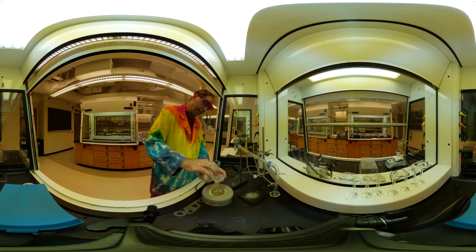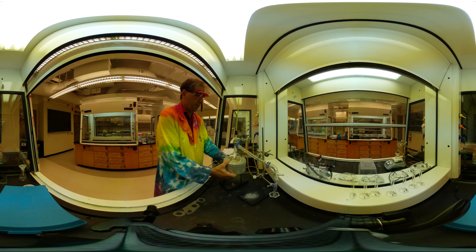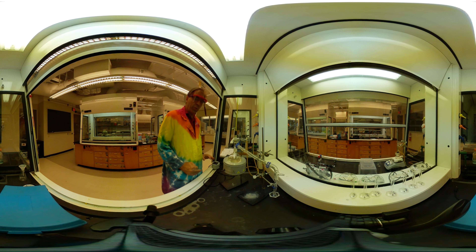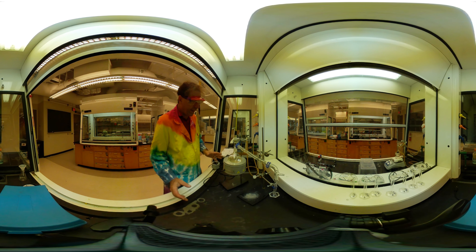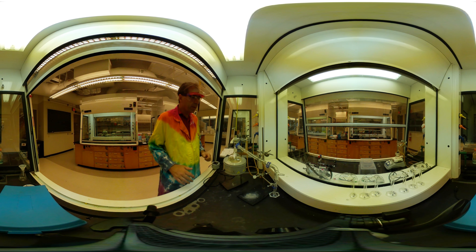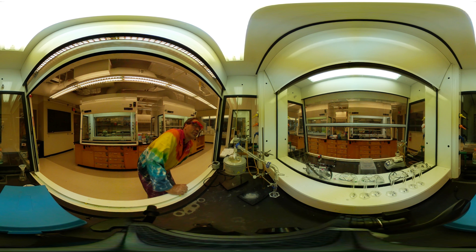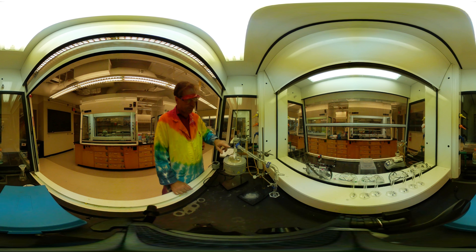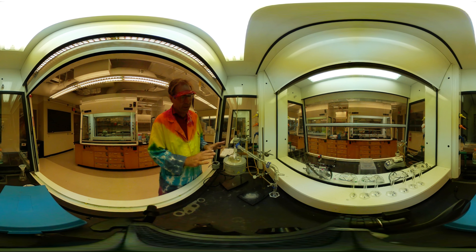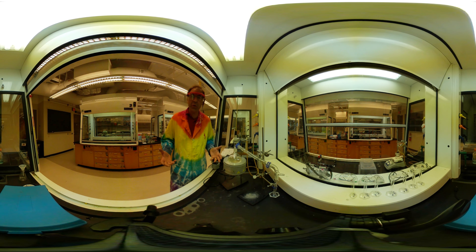Bring this up and get this all lined up to make sure we have a good seal here. I'm going to turn this on again. I'm going to be a little more conservative this time because it tends to go a little bit quicker, but we're going to go ahead and start heating again. I have my thermometer. I can take my initial temperature here — the room's a little cool at 20 degrees Celsius, but I positioned the thermometer at the point where it goes through the condensation. So we'll come back to this in a few minutes once we have the reflux started.